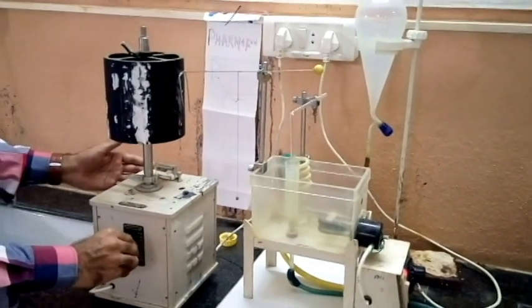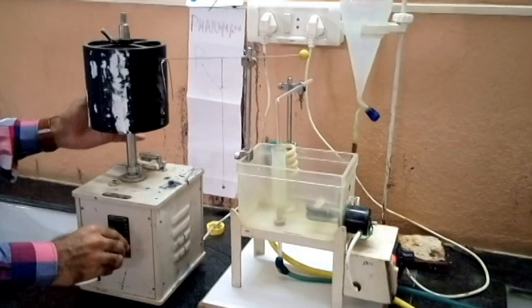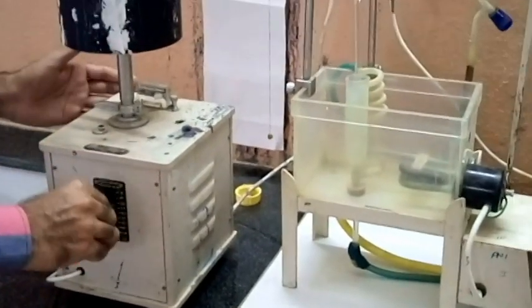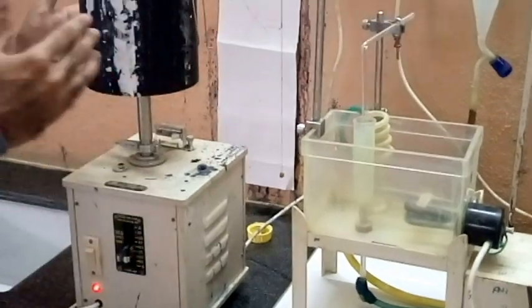I can adjust the speed of the rotating drum. Either I can decrease it or I can increase it. So depending upon my convenience, I can either increase it or decrease it.